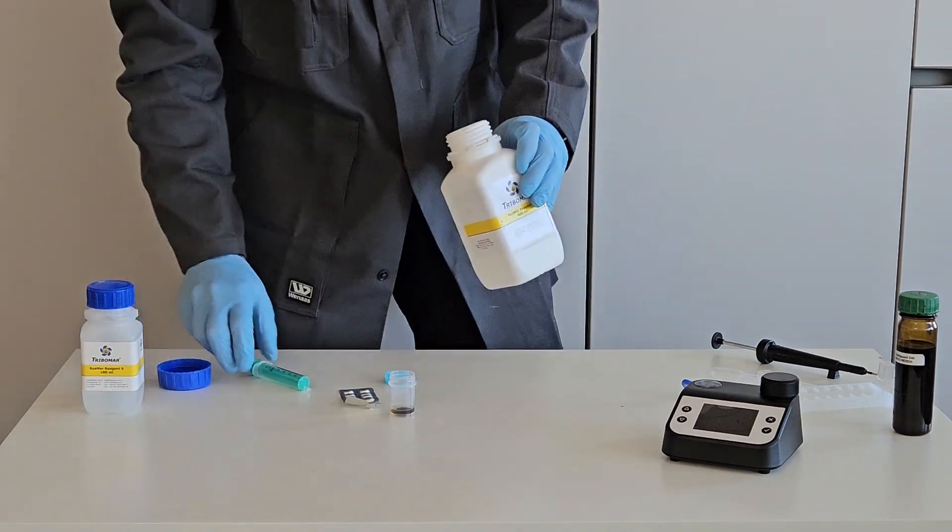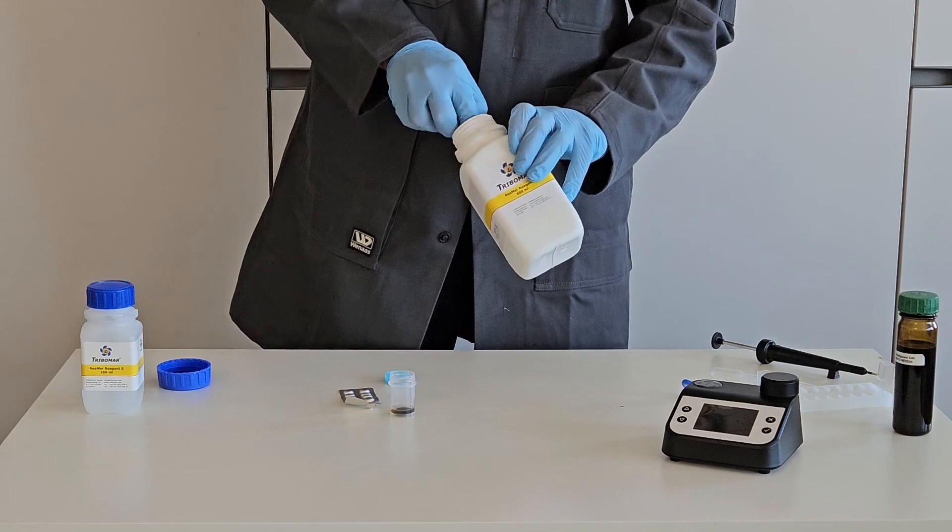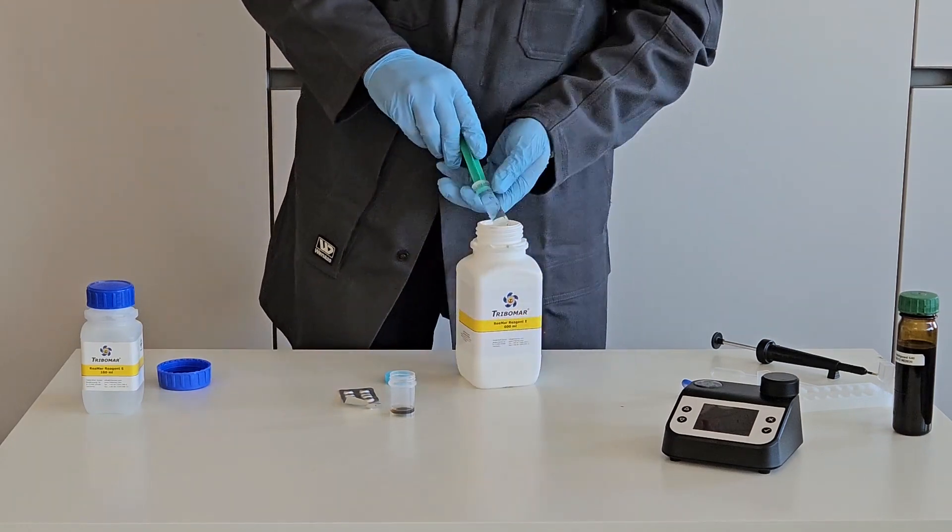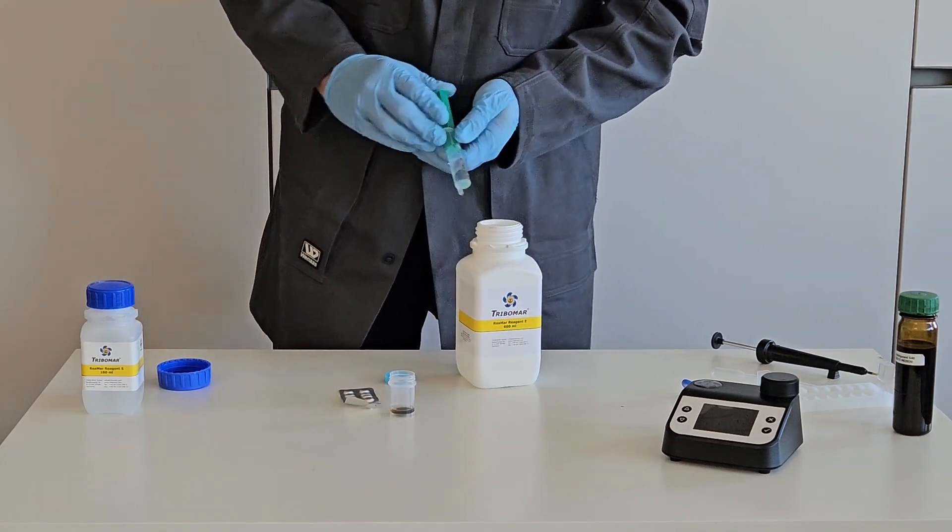Third, 10 ml reagent E with syringe. Both pipette and syringe can be reused.